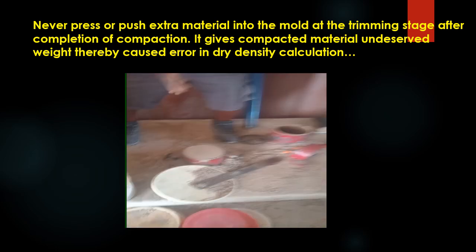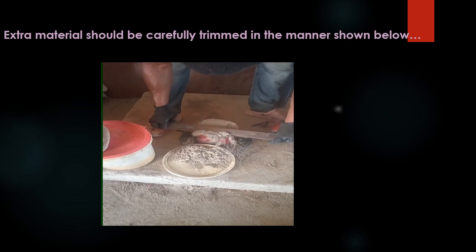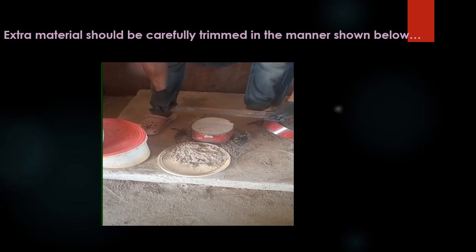Never press or push extra material into the mold at the trimming stage after completion of compaction. It gives the compacted material undeserved weight, thereby causing error in maximum dry density determination. Extra material should be carefully trimmed in the manner shown below.